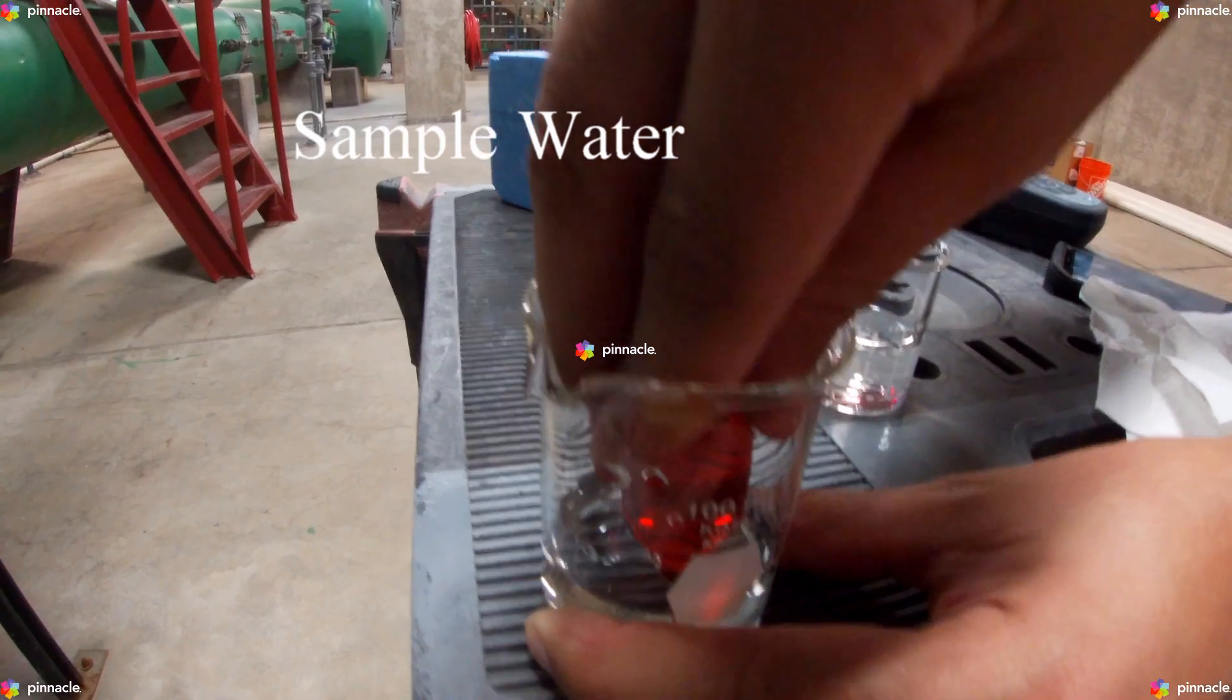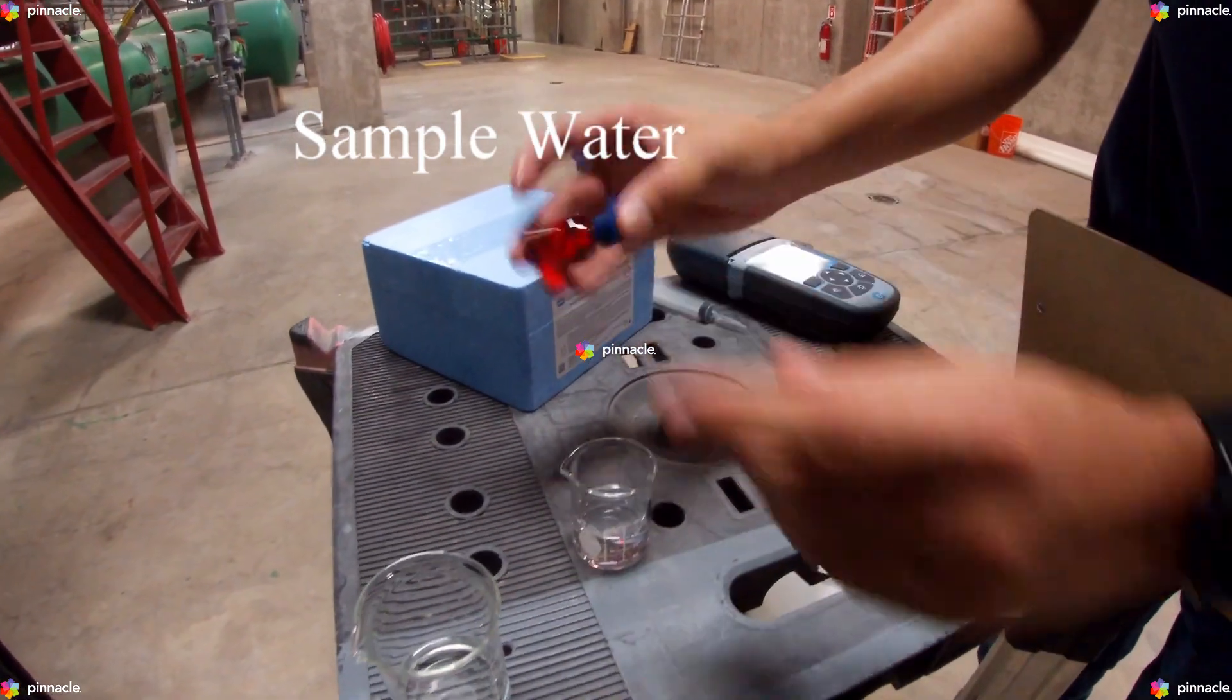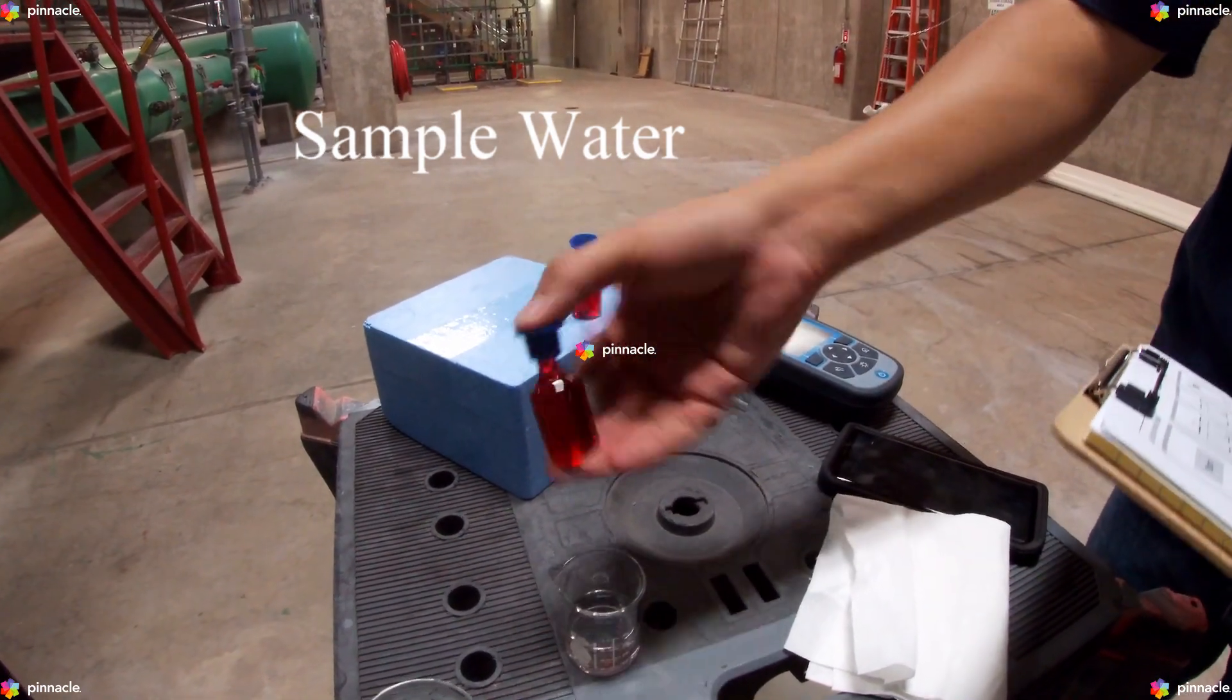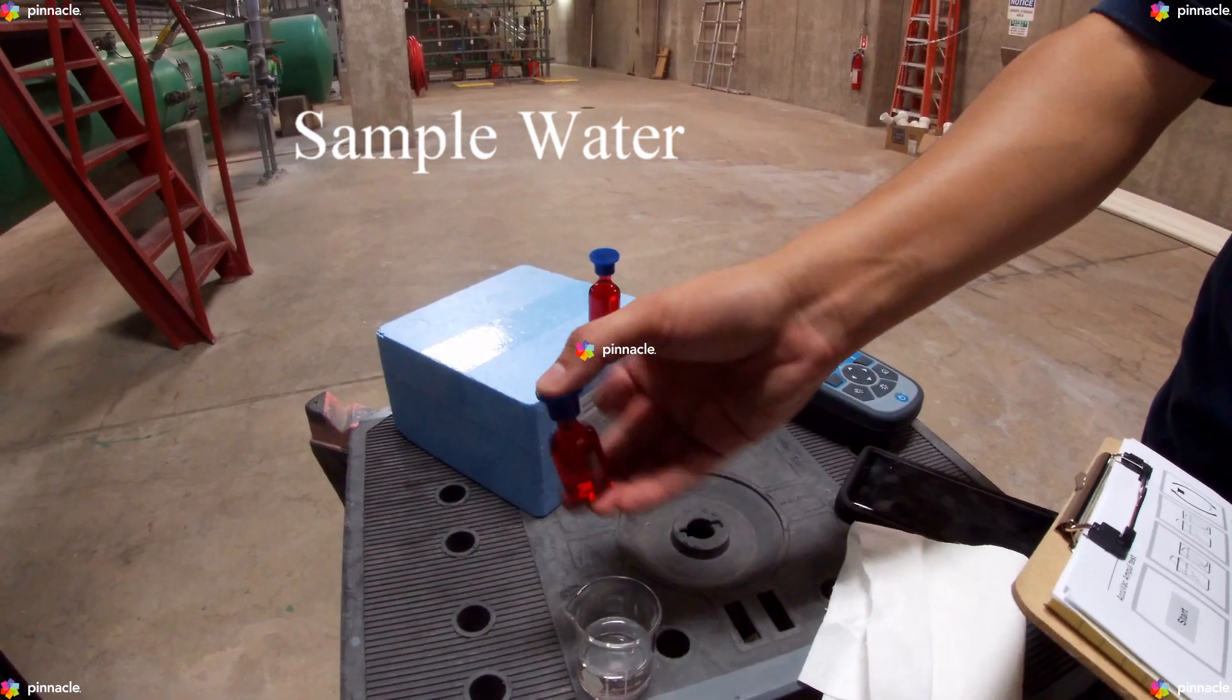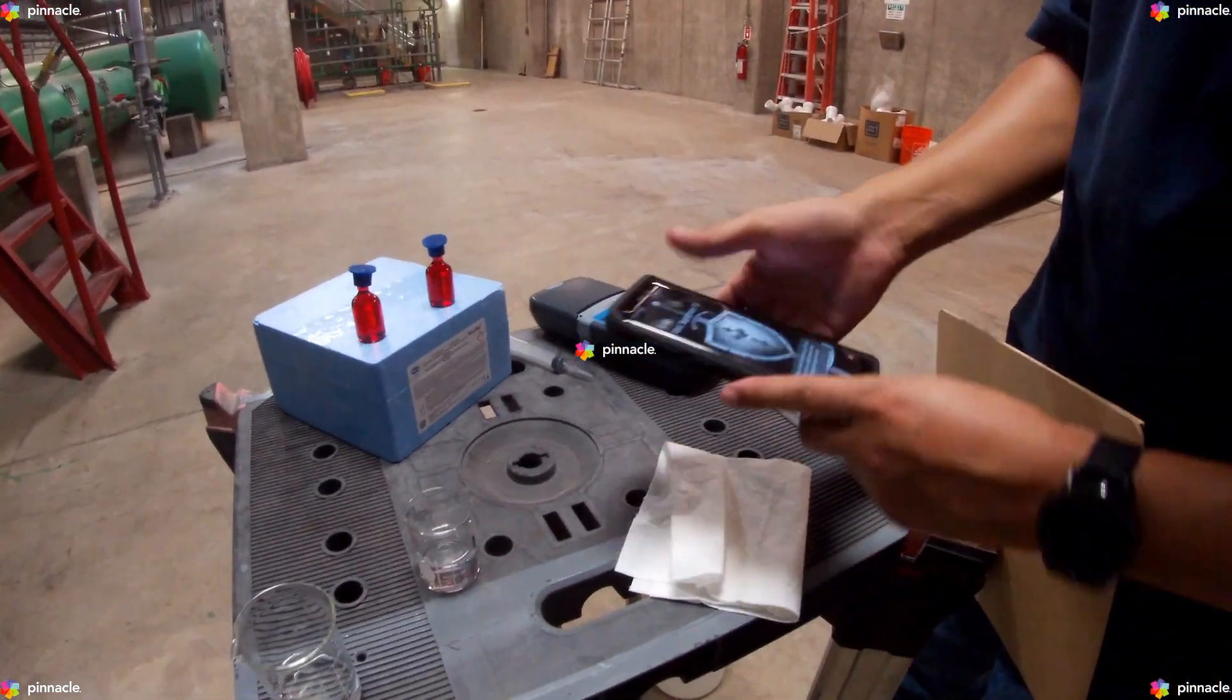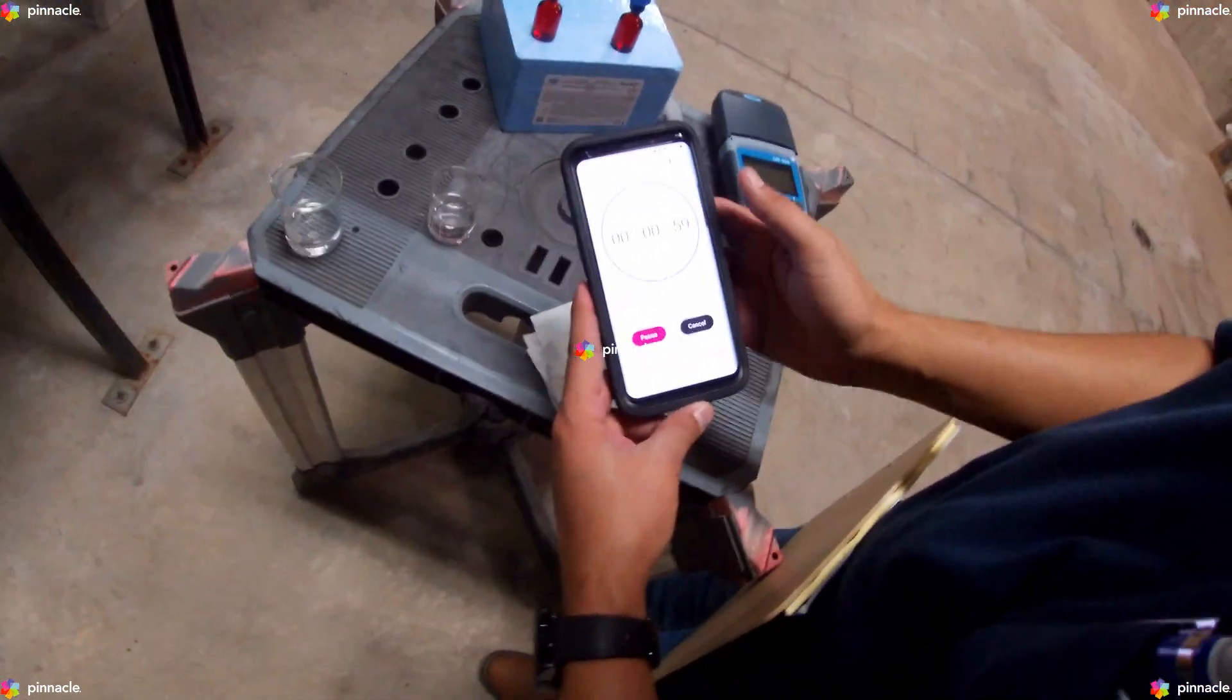We will quickly invert the AccuVac Ampoule several times to mix. We will now start the instrument timer. A one minute reaction time starts.